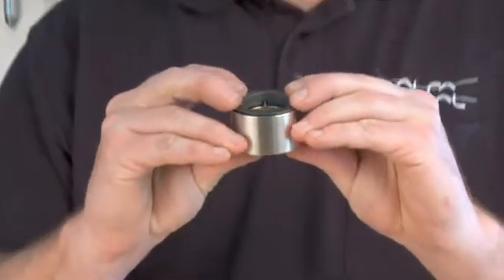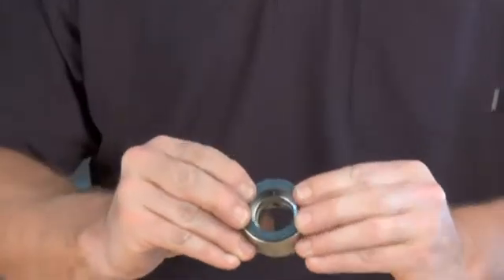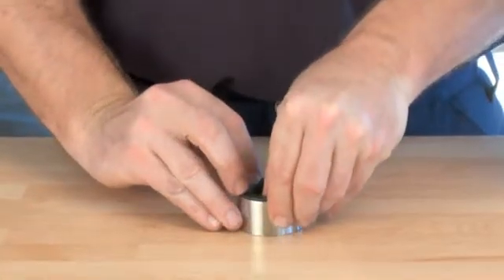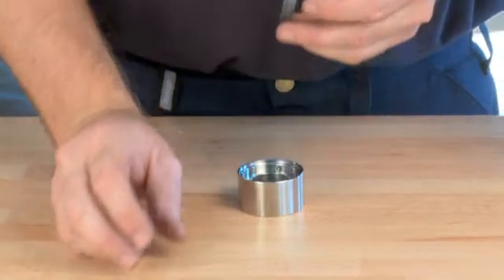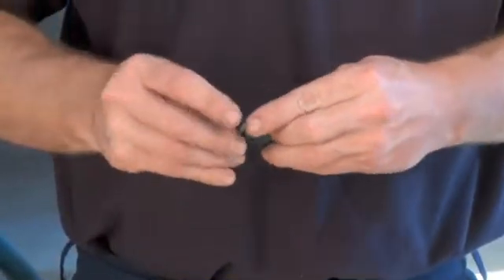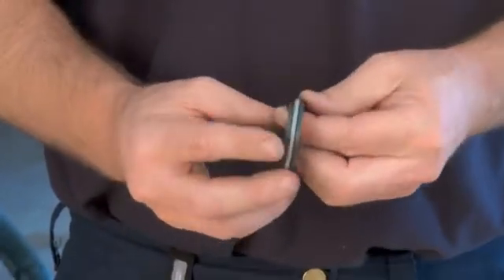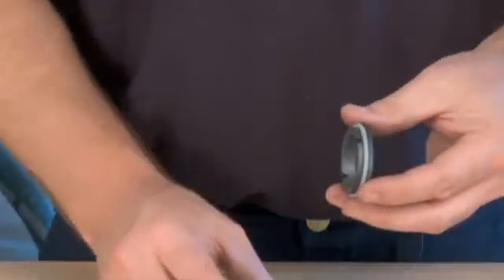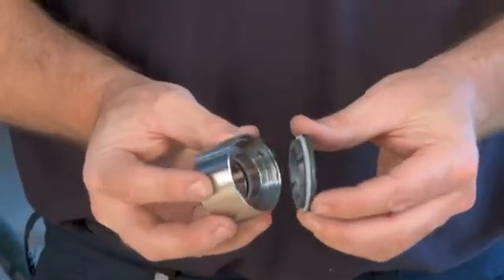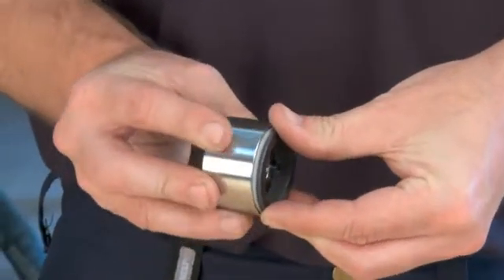Make sure that the seal part does not rock more than shown here. Remove the rotating part of the seal. Mount the O-ring on the rotating part of the seal. Place the rotating part of the seal in the seal housing. Check that the pins are in the proper position.